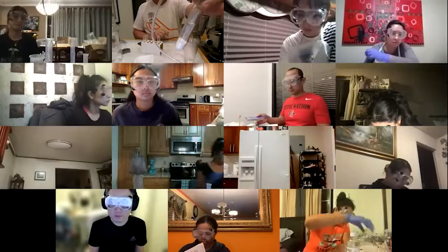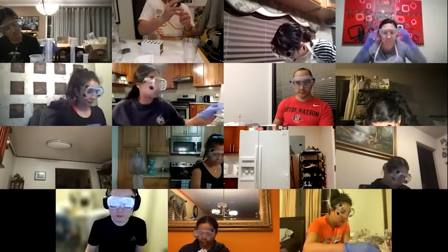Okay, so I've got my lime water in here, about 4, maybe 5 mils. Then this big tube, I've got solid sodium bicarbonate in the bottom and acetic acid in a separate tube on the top. And when I shake it up, it should start to produce CO2. Then I've got the stopper on the top, and then a tube where the CO2 can flow out of. So let's start this bad boy.